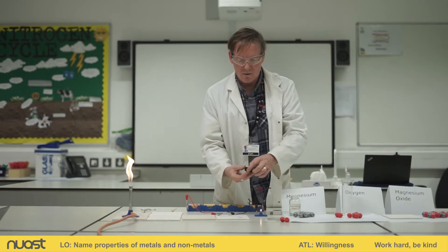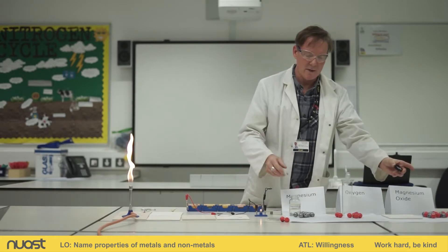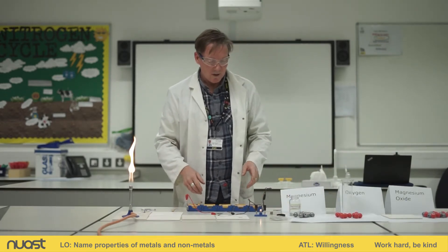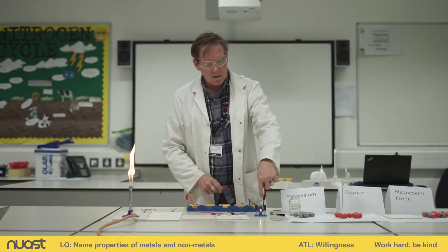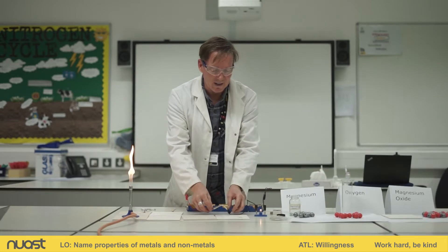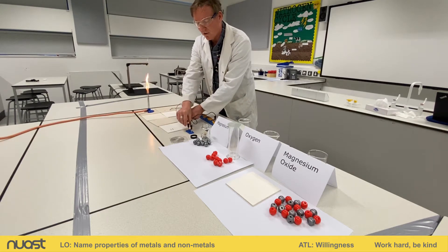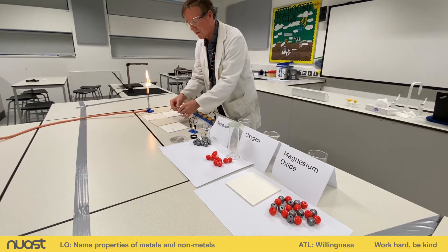Here I have my magnesium — some magnesium ribbon, small pieces here in this lid. You can also get bigger bits too. We're going to look at a couple of properties of the magnesium. I have a circuit here: a row of five batteries connected up by a wire to a bulb, with some more wires and crocodile clips at the end. You can see I have connected a piece of magnesium up to the circuit — it's completing the circuit and the light is on.